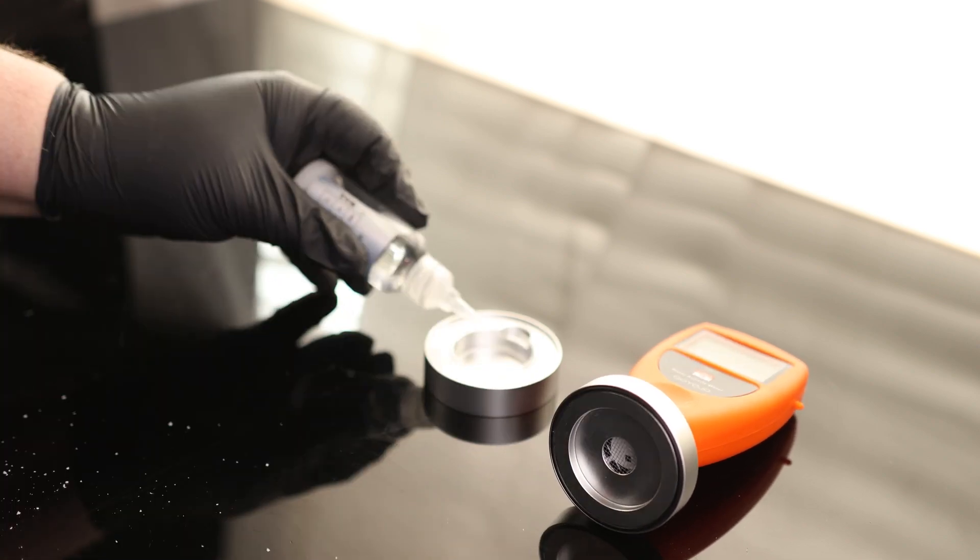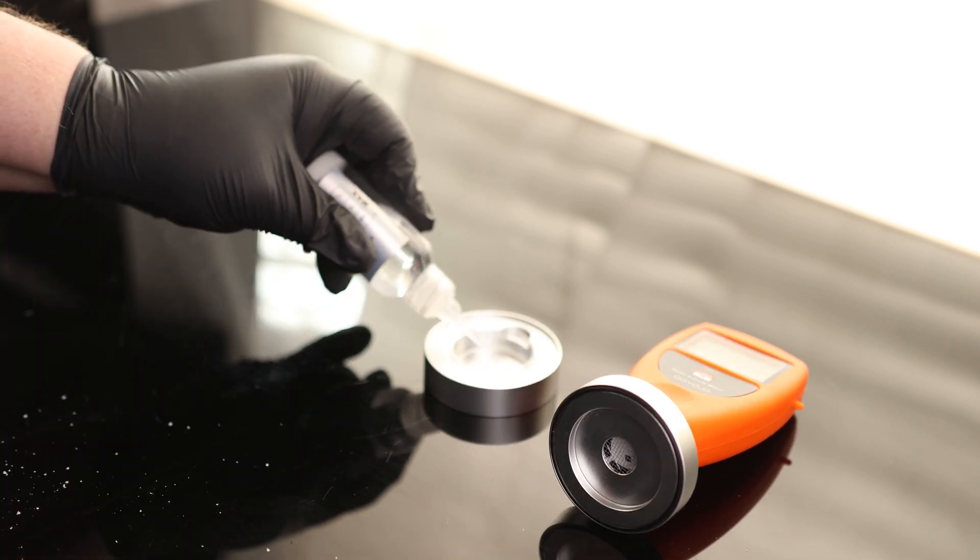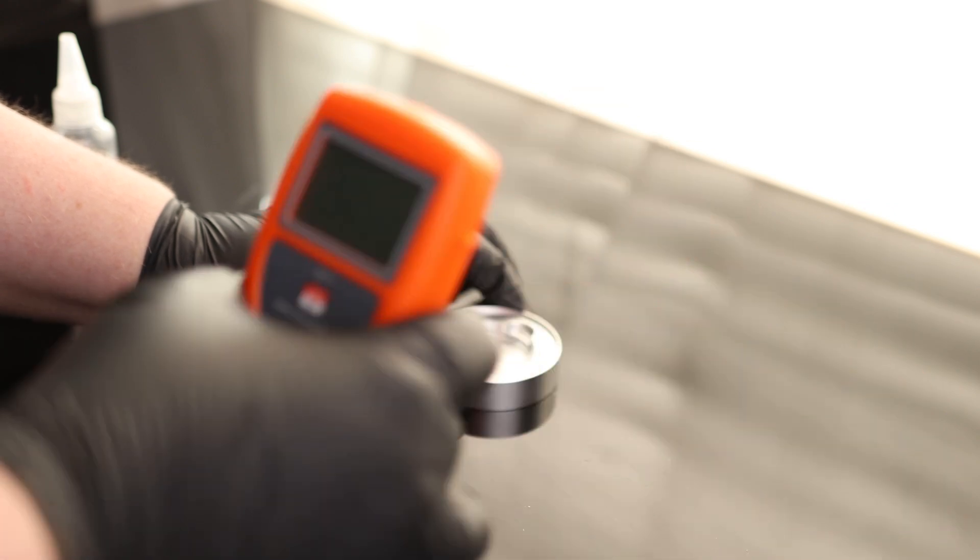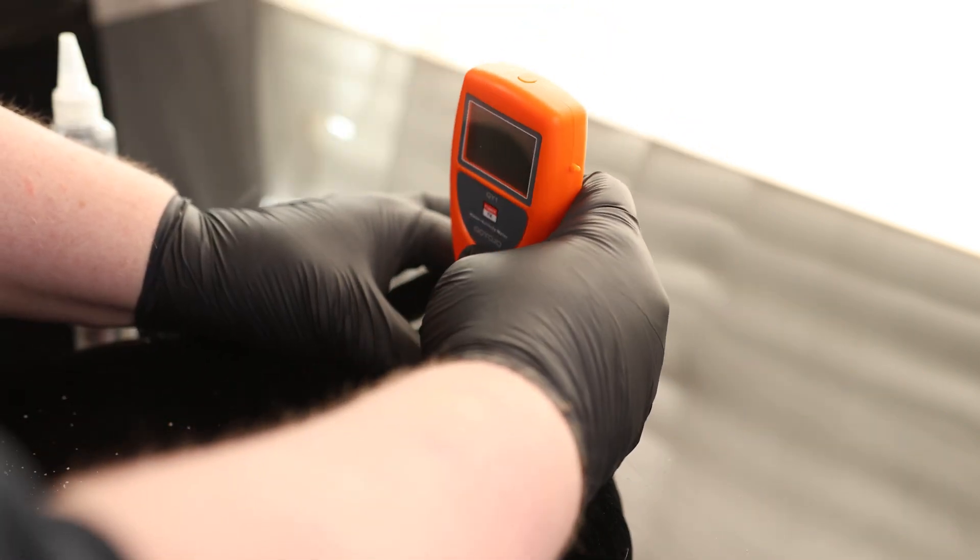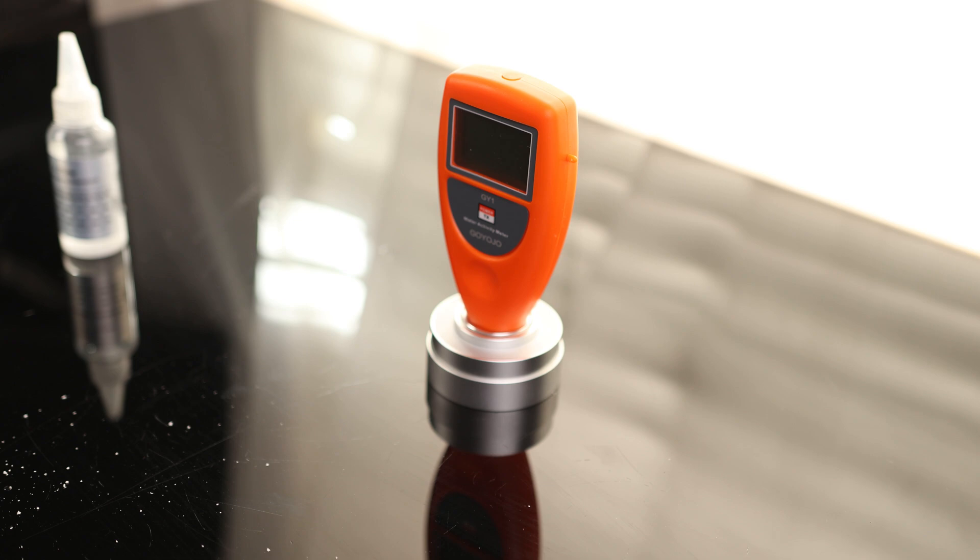We want our testing cup and we want to fill it so it is just about under half full. We want to hold the base because this is magnetic and we don't want it to shoot up into the sensor. So just hold that, drop it on. Now we're going to let it sit for about a half hour.